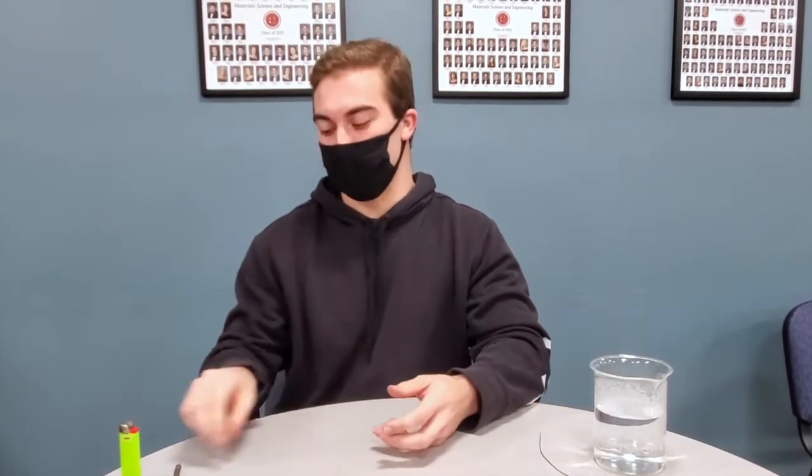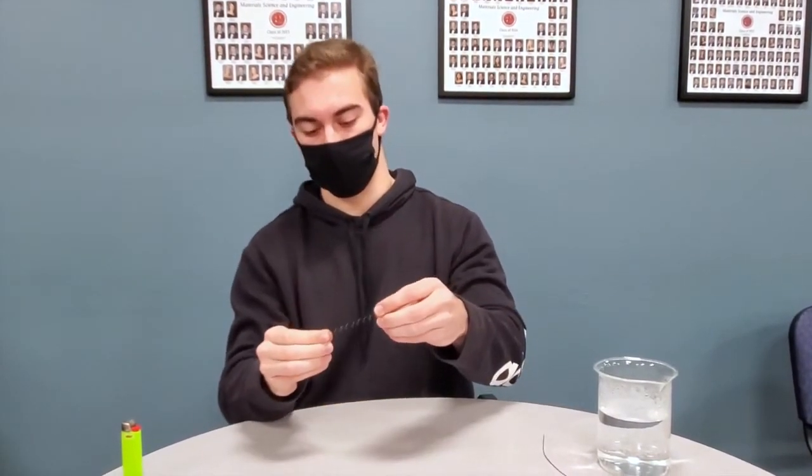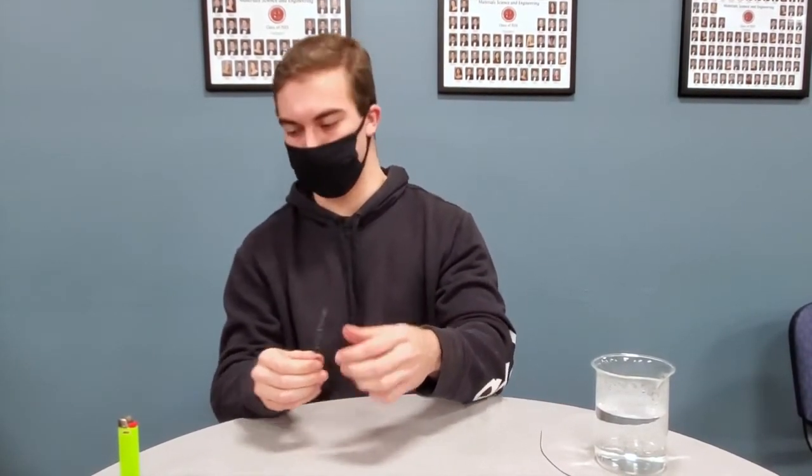Hello, my name is Thomas Canfield. I am a senior in materials science and engineering here at Virginia Tech. Here I'm going to be doing a demo with a nickel and titanium alloy, which has been coined as a shape memory material. As I will demonstrate, when you look at this material, we're going to stretch this spring. As we stretch this spring, it's currently in its martensite phase at a cooler temperature.